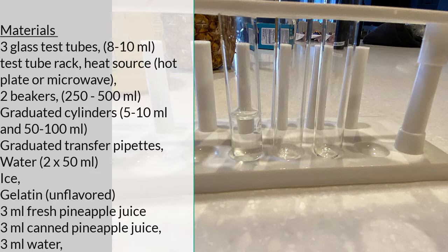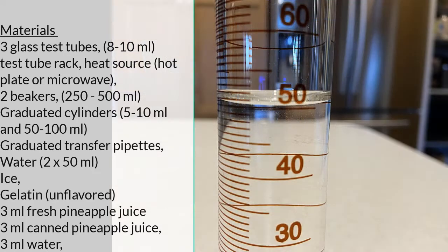Two beakers of 250 to 500 milliliter volume, graduated cylinders with either a volume of 5 to 10 milliliters and a volume of 50 to 100 milliliters, a few graduated transfer pipettes.